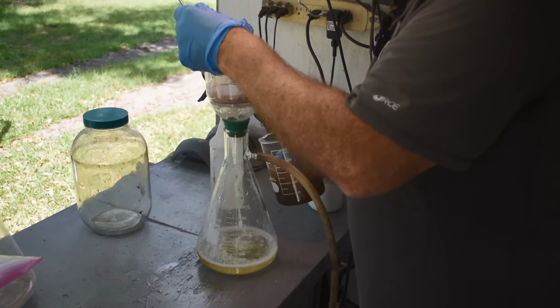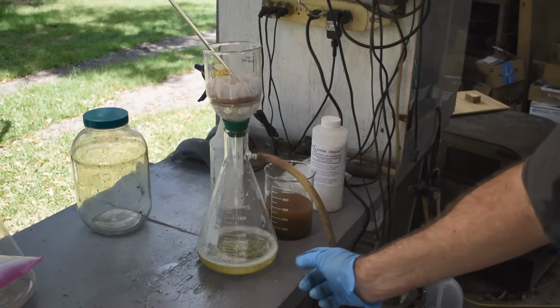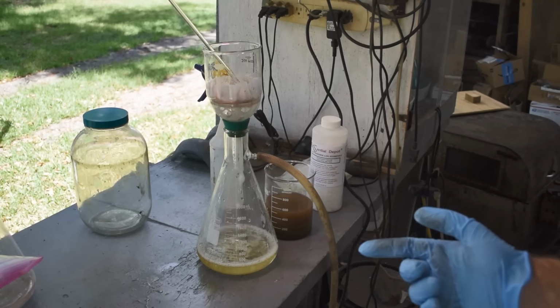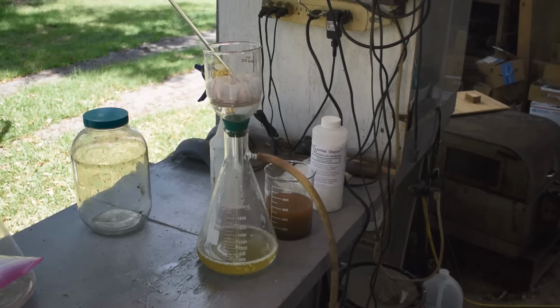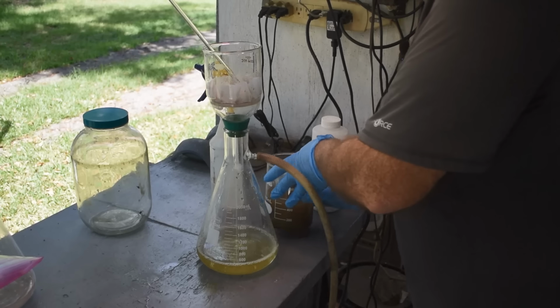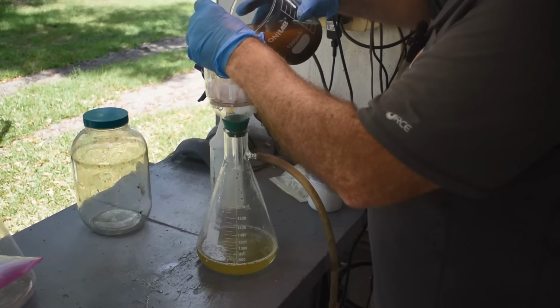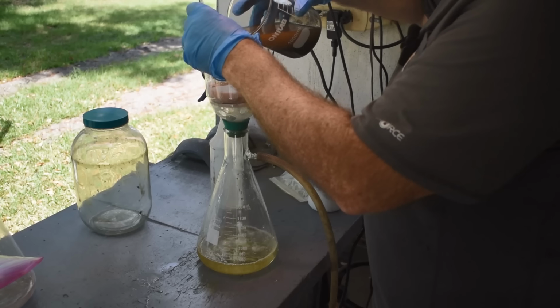Those solids should consist of metal hydroxides, tin, copper, any other metals in those pins, and gold. So, I think we can just pour it in now. There we go. That beaker was pretty full before.